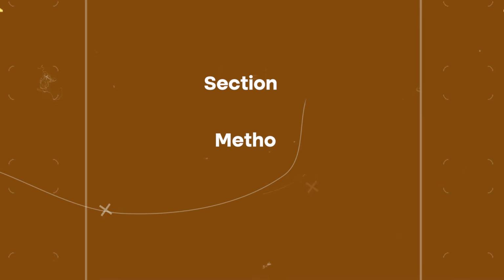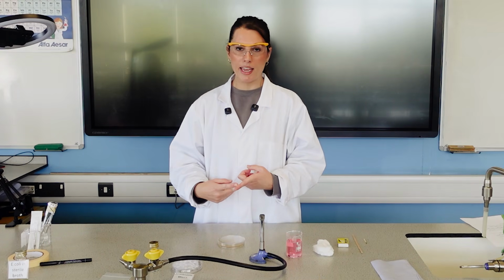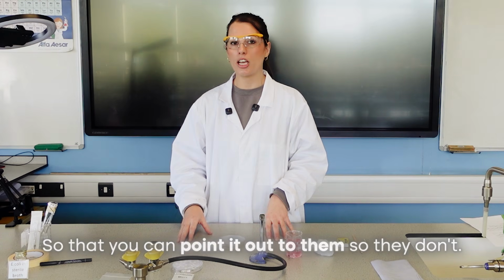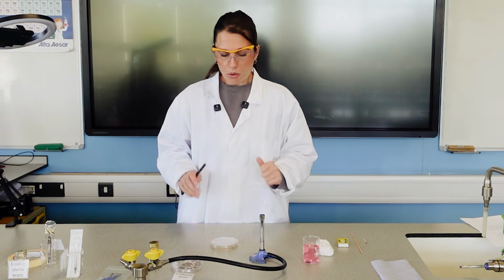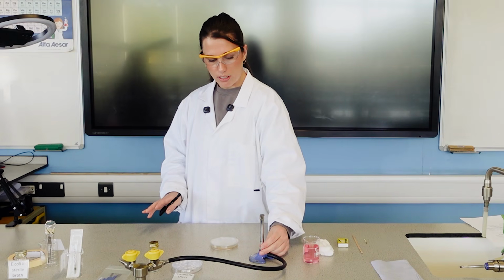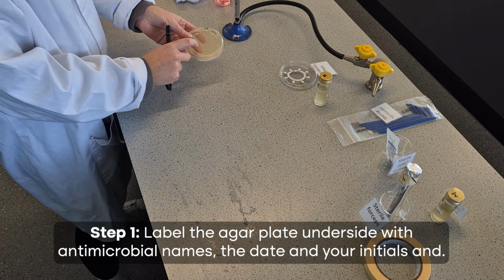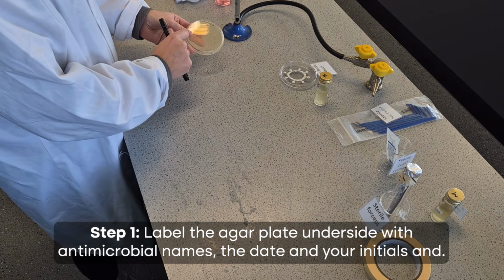But now let's get into the actual practical, and as we go through, I'll point out some key mistakes students make so that you can point it out to them so they don't, and some key tips as well. So I've washed my hands with soap, I've disinfected the surface, I've got my roaring Bunsen burner flame set up. I've actually got some labels already on my Petri dishes because these were pre-made by the technician.